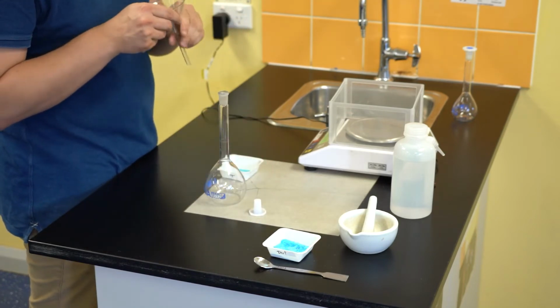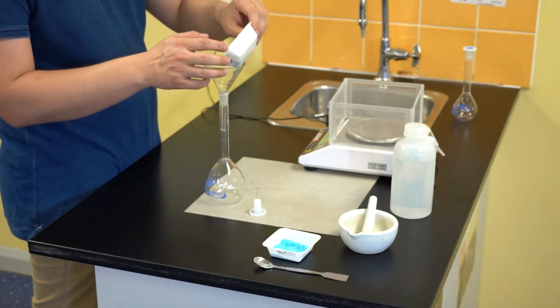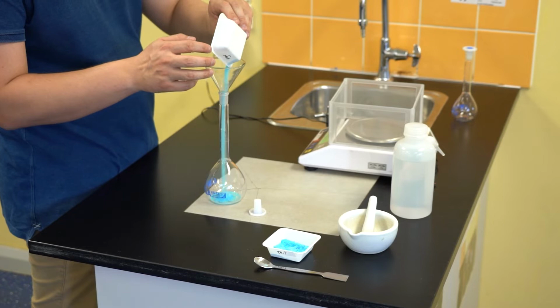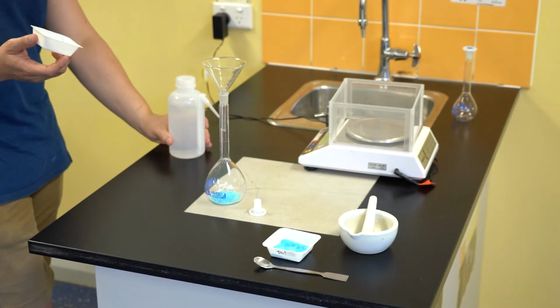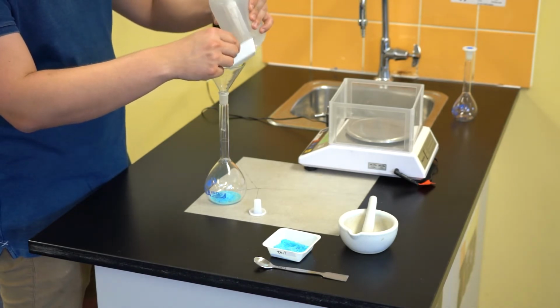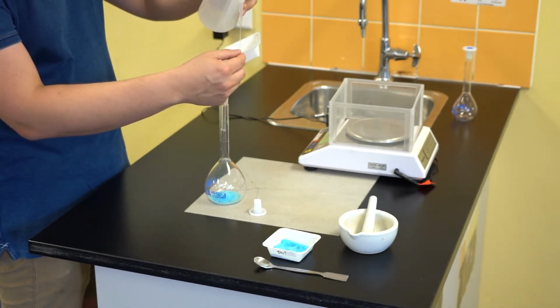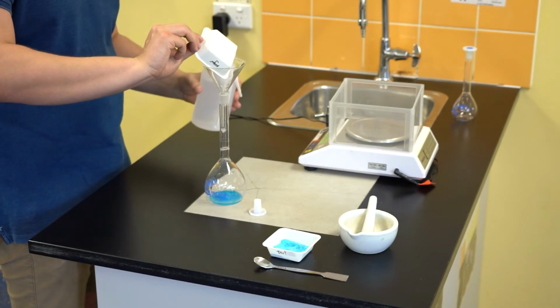I can then place a funnel into the volumetric flask and directly transfer the powder into the flask itself. Generally, you want to put your solid in first. If you start trying to add water during this step, for some solids, you'll end up hydrating the solid, meaning that it's going to end up forming a much clumpier crystal and it's not going to dissolve properly straight away anyway. This clumping can occur in the lower part of the funnel and end up clogging everything up, which can be a little bit problematic. I'm then going to rinse the weigh boat followed by the funnel with distilled water. This is going to ensure that all copper sulfate particles that were weighed are being transferred into the flask.